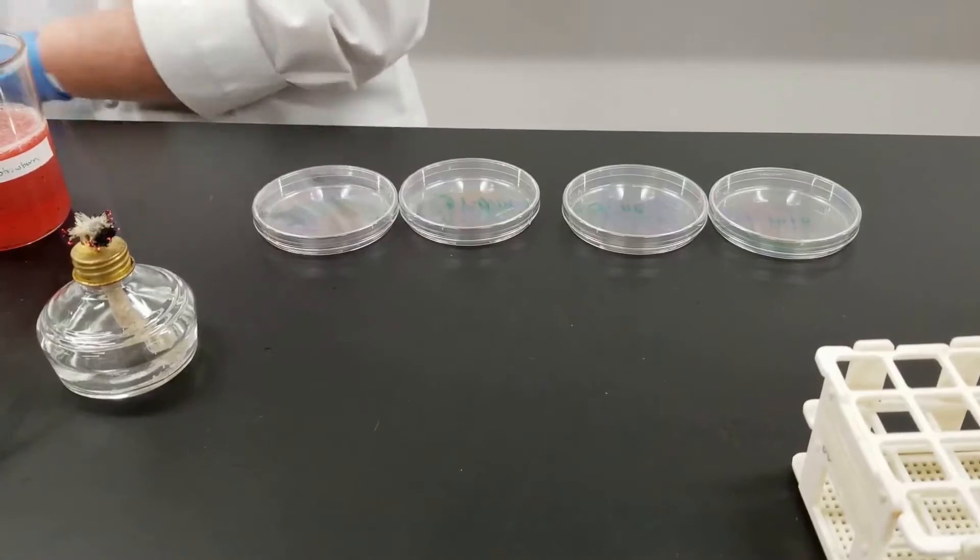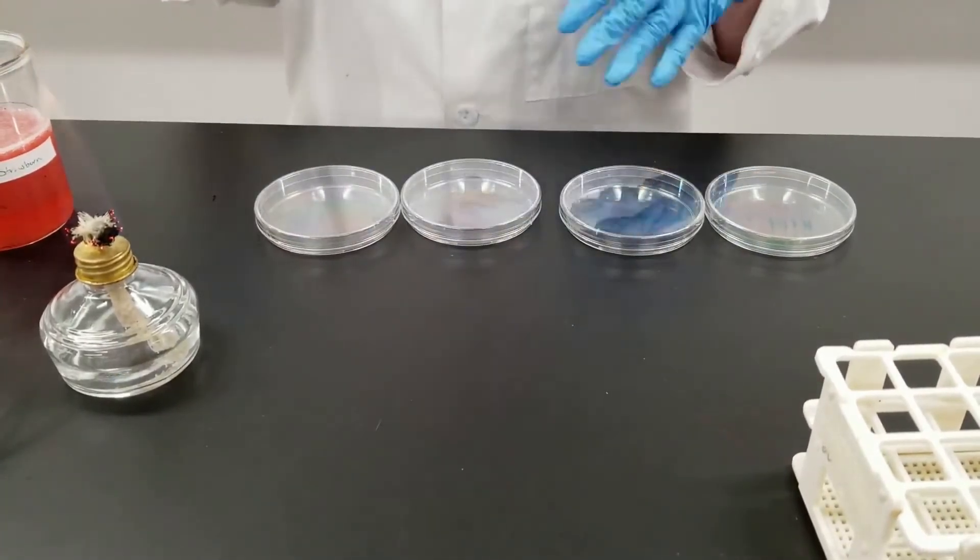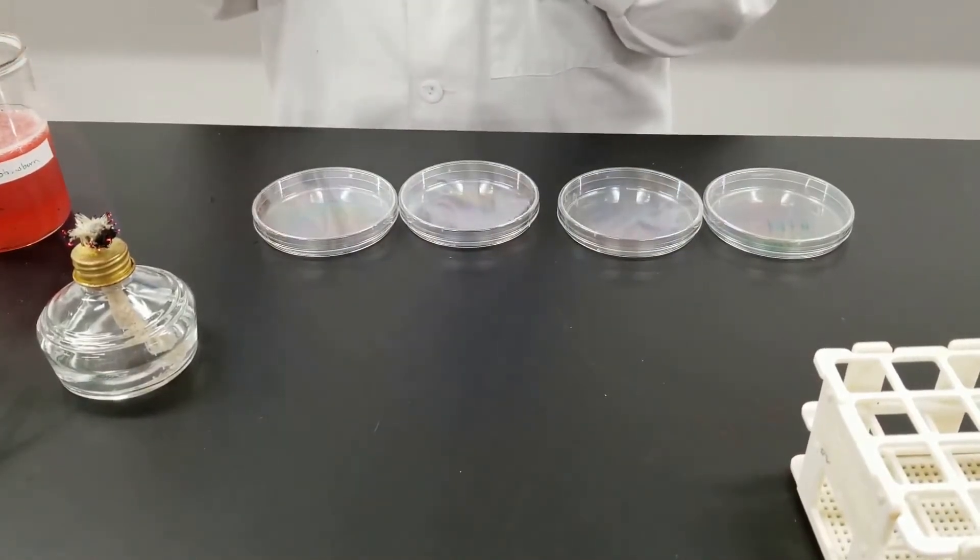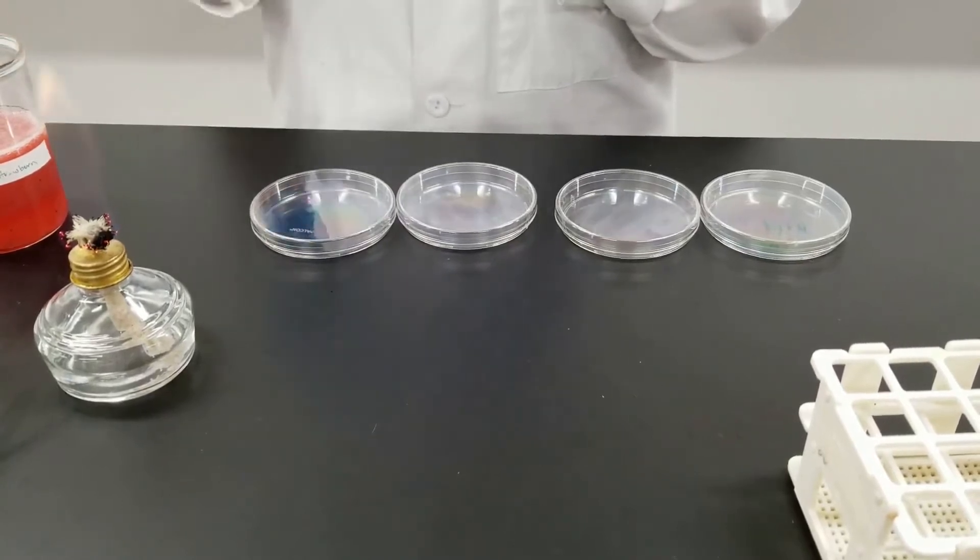We want to dilute this out because we don't know how contaminated it is, so we're going to start off with a relatively strong concentration and then progressively dilute out.